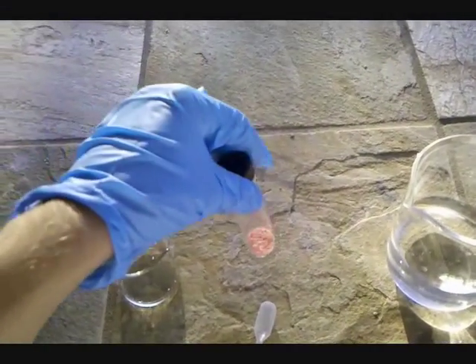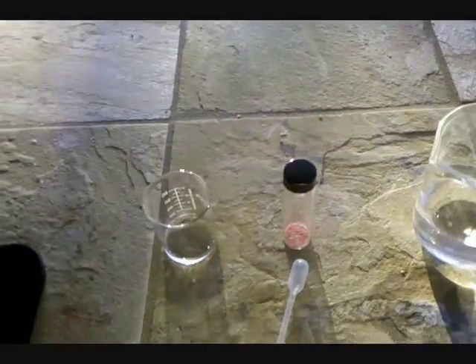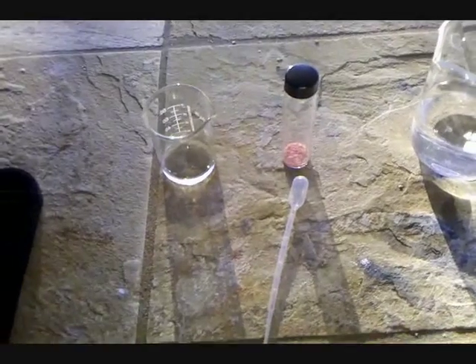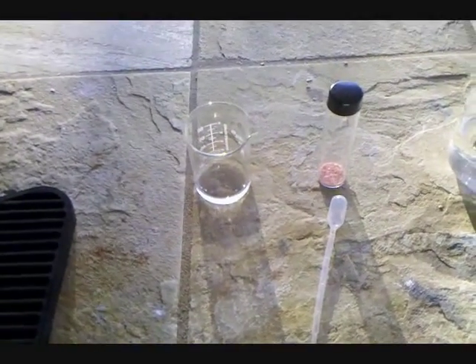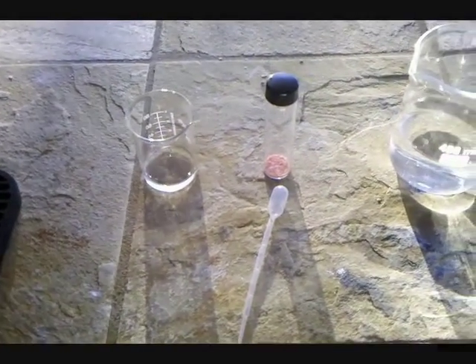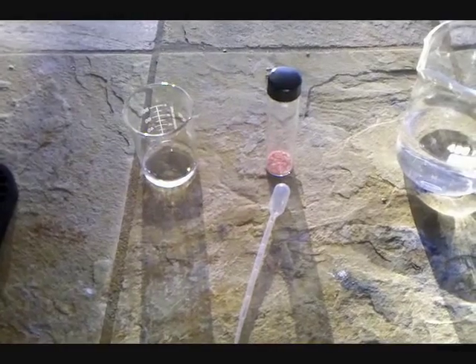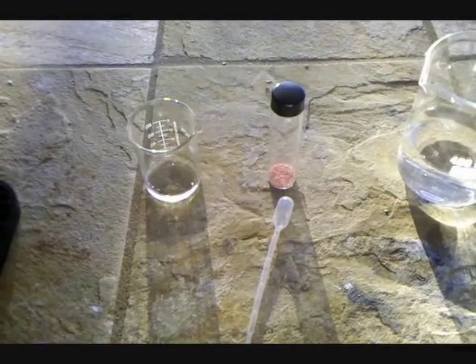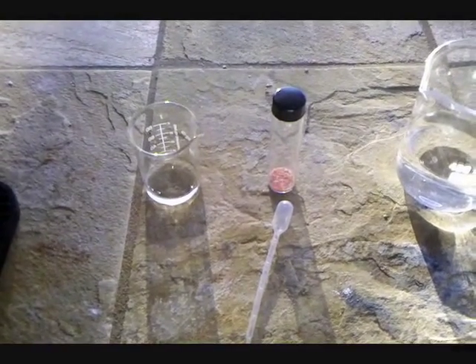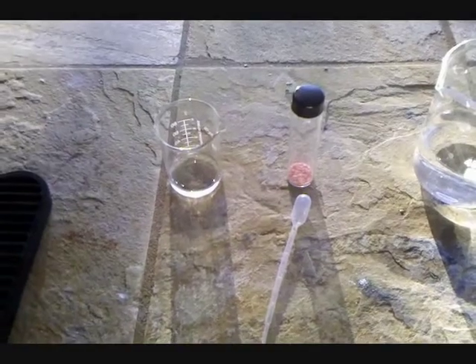Also, you want to crush the sodium chloride into a fine powder and mix them very thoroughly, because the sulfuric acid will react with the sodium chloride to make hydrogen chloride gas, which can quickly fill up the area, as I have experienced.